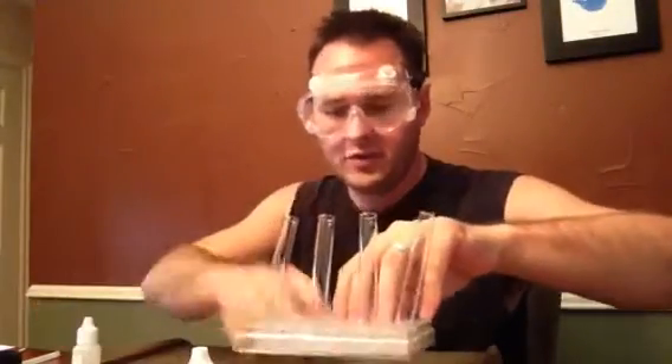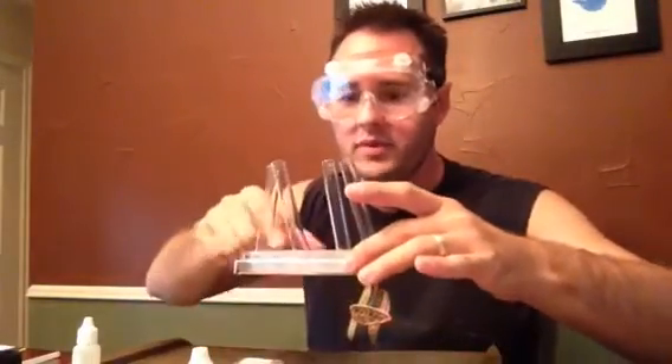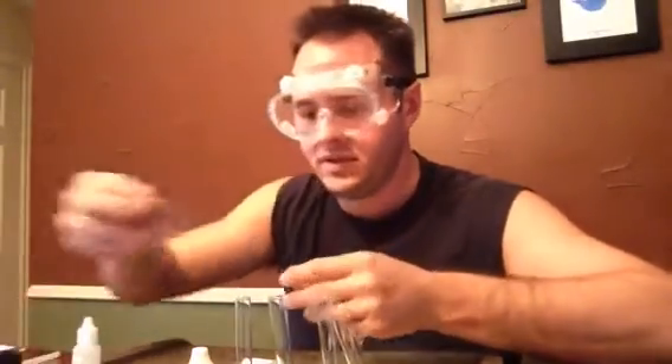Safety goggles, and I've got the test tubes — my pack only came with four of them, but I'll make do. I've got them in what I believe is the well plate tray; it wasn't labeled but it does say 24 and there are 24 slots, so I assume that's for holding these up. Let's see the other pieces — I've got the pipettes, I believe, the empty short stem. I'm not sure exactly how that's going to go in there just yet.